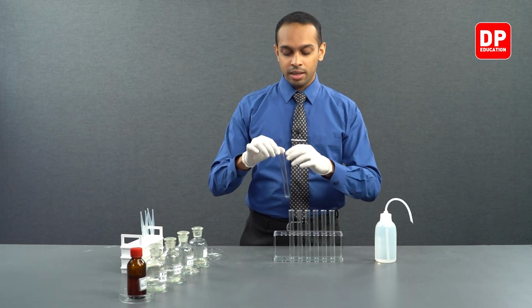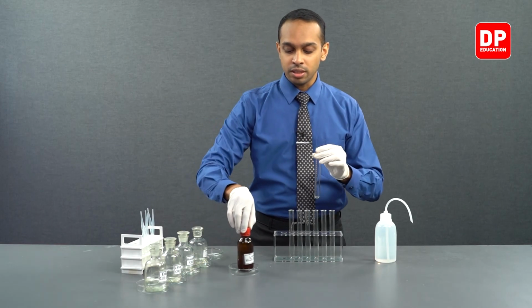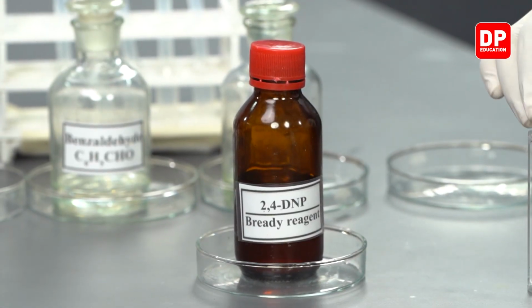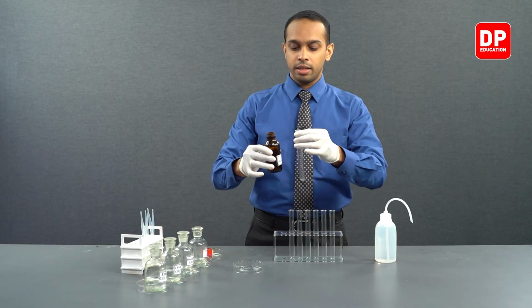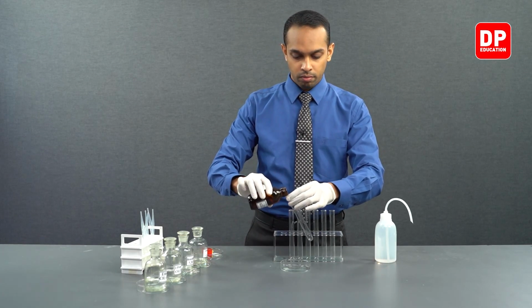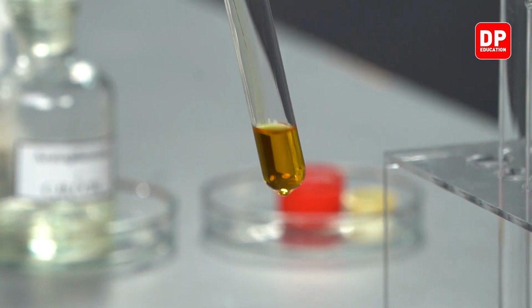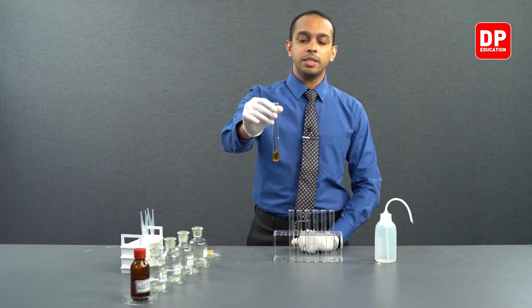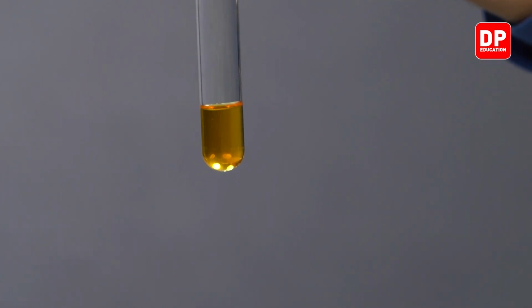So let's take a test tube and take our 2,4-DNP reagent so that you will be able to observe the color of 2,4-DNP. We'll take a small amount of 2,4-DNP to our test tube here. So we have our 2,4-DNP solution over here. We can see a characteristic orange-yellow color.